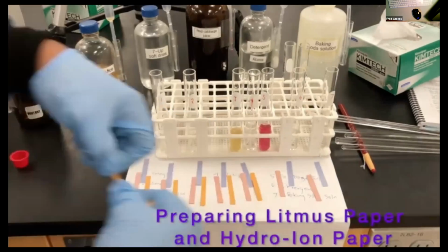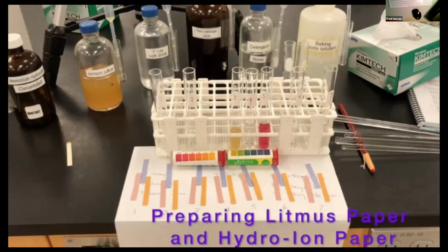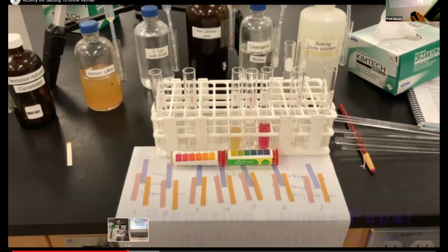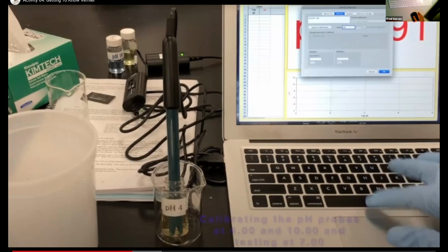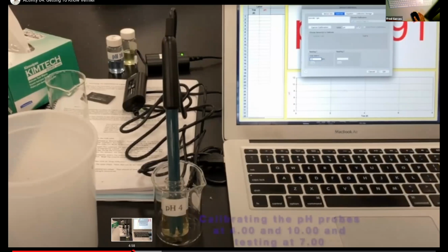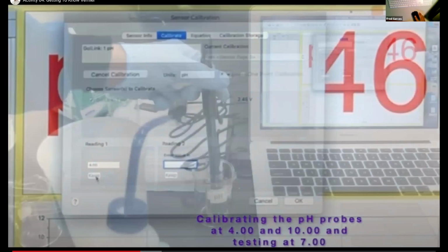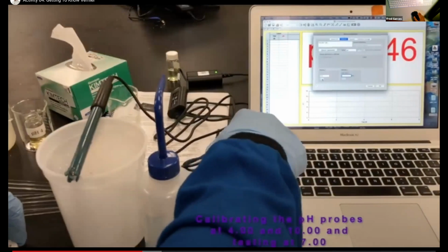You have the solutions, and then you have litmus paper, and you have something called hydrion papers. Hydrion papers will change color depending on the pH. So what happens first? Well, we're just going to test each one of these individually. Well, before we do that, we calibrate the pH probe. We've got to calibrate it to pH 4 and pH 10, and then we test with pH 7. So that first part is just the calibration of the probe.